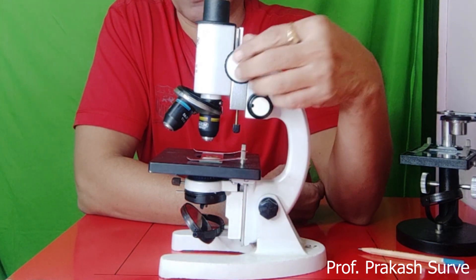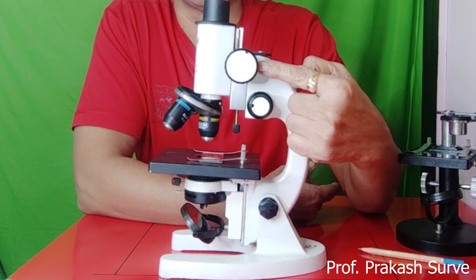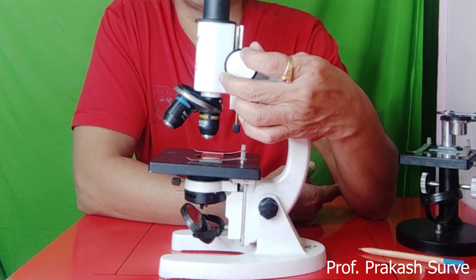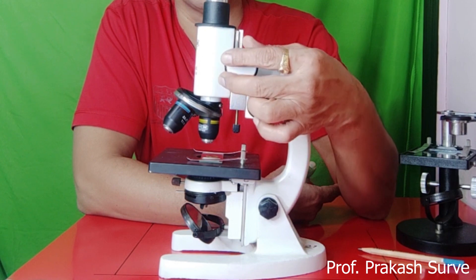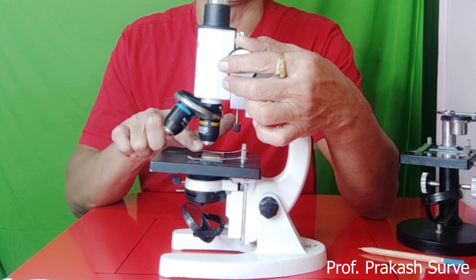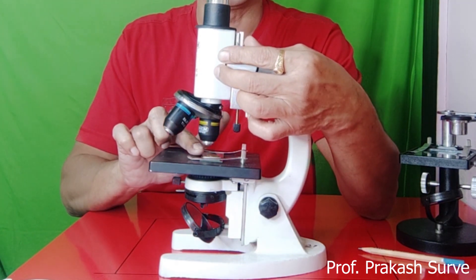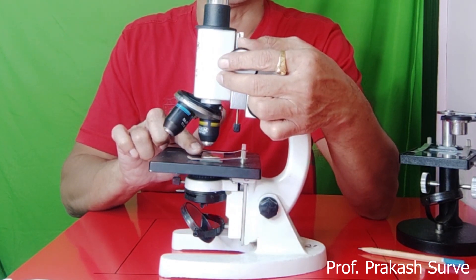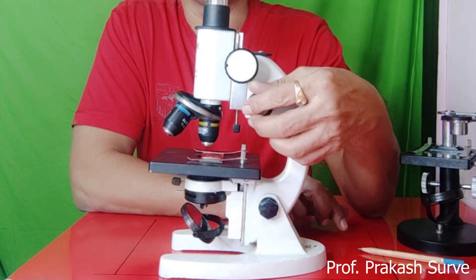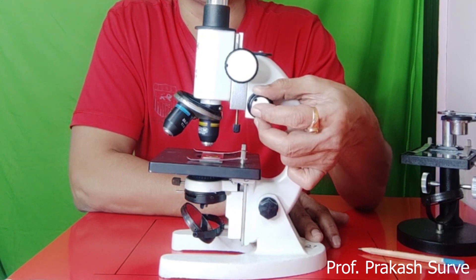Next are the adjustment screws. The rough adjustment screw is used to get a rough image of the object — you keep approximately one finger thickness distance between the object and the objective. The fine adjustment screw is then used to get a more clear image of the object.